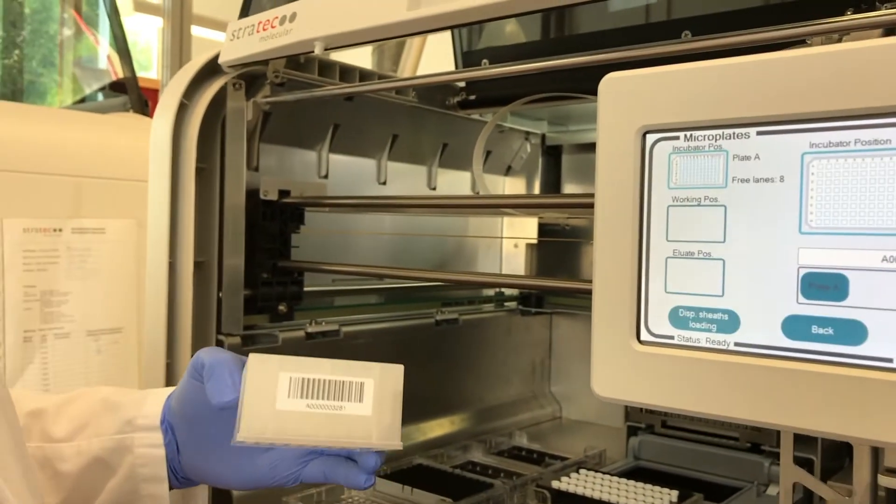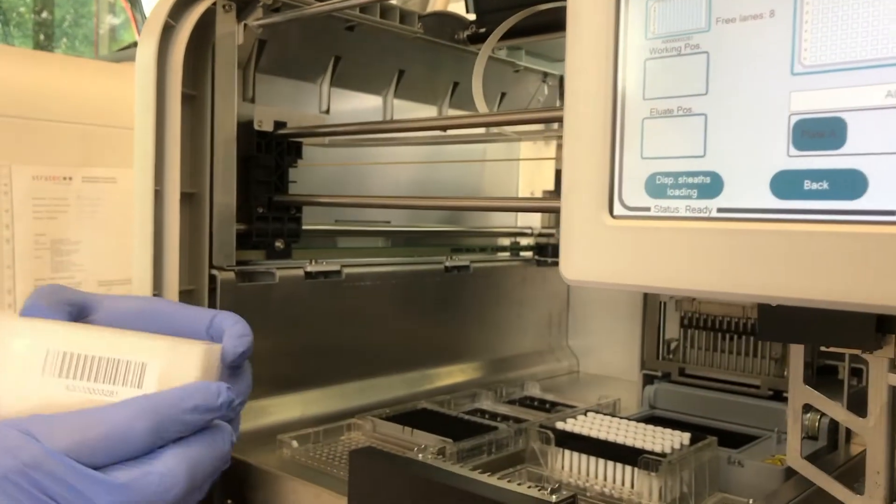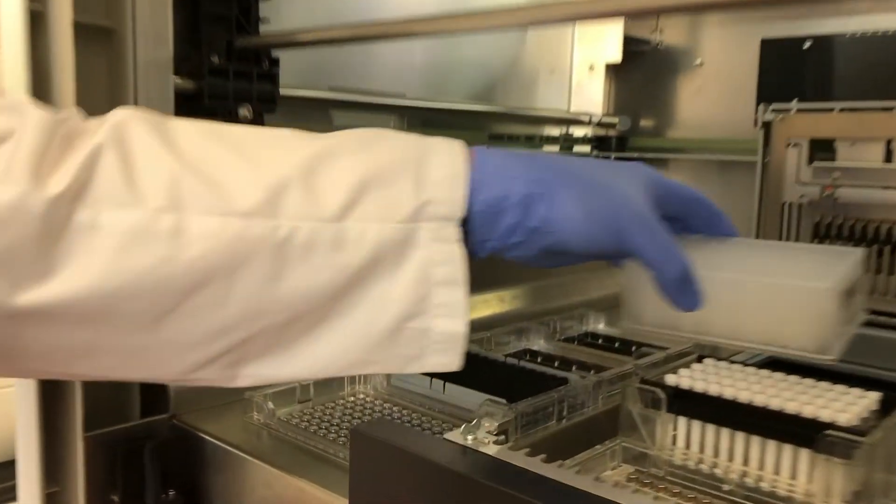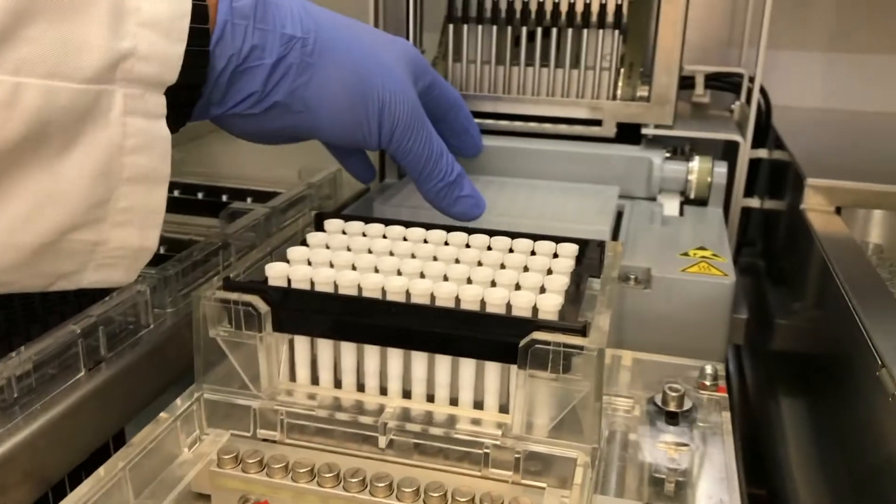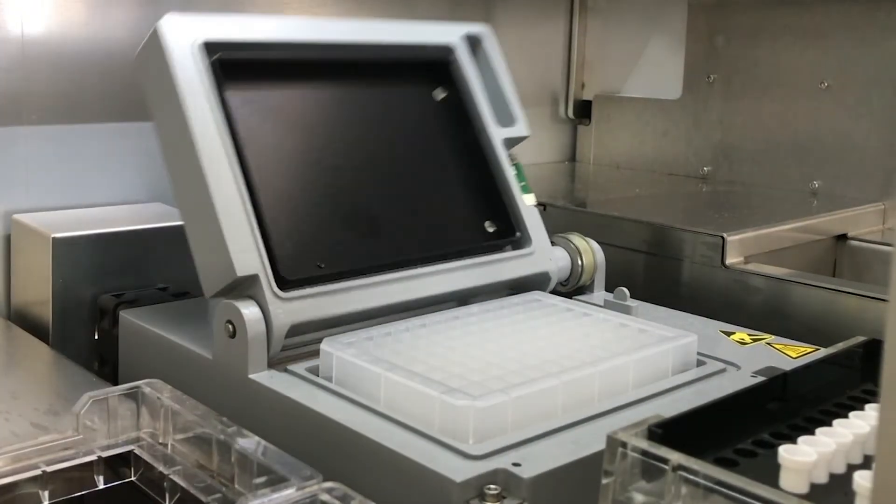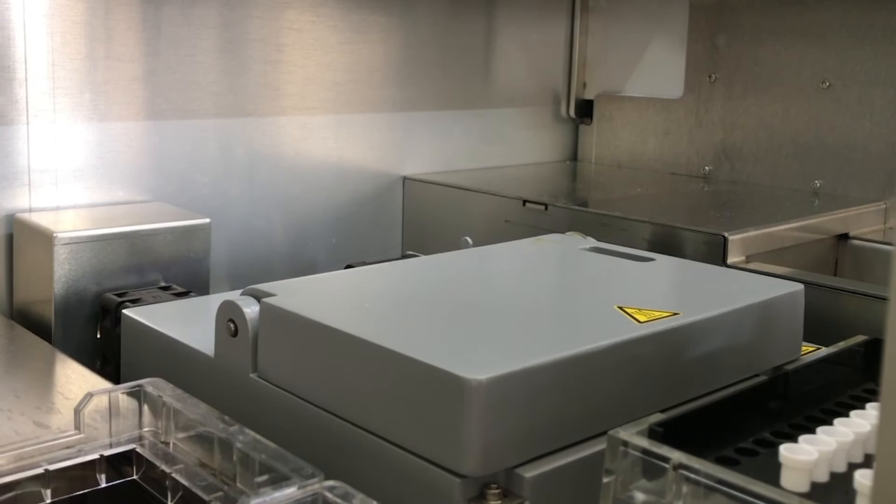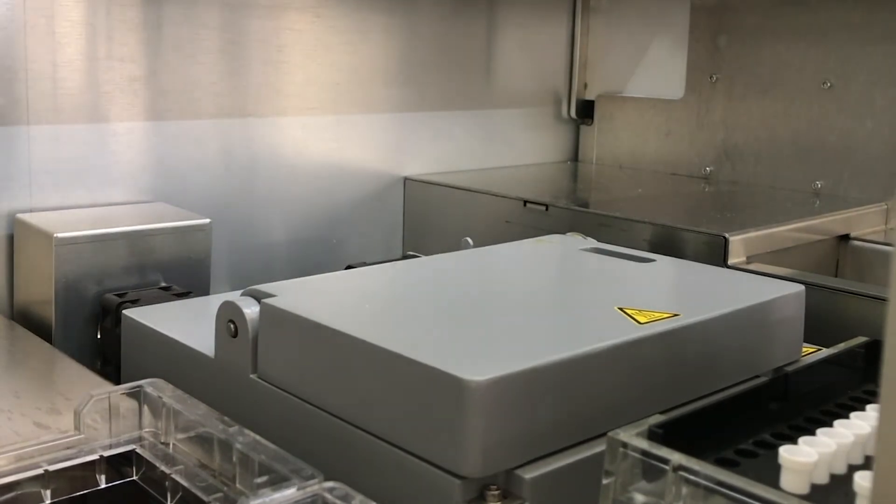Scan and load the incubator plate. Position it to the heating block. The heating block can be closed to avoid evaporation during sample lysis.